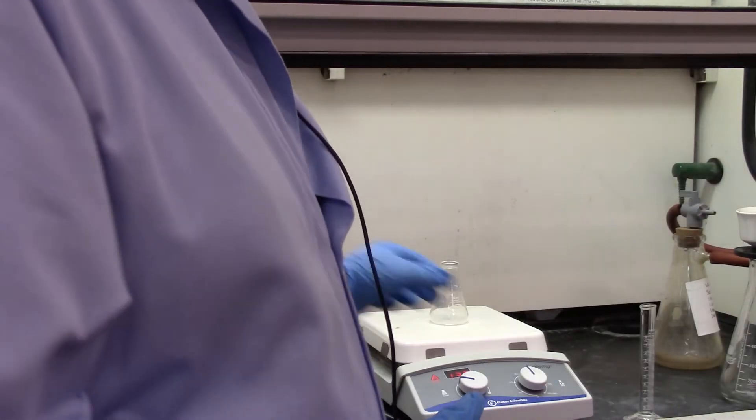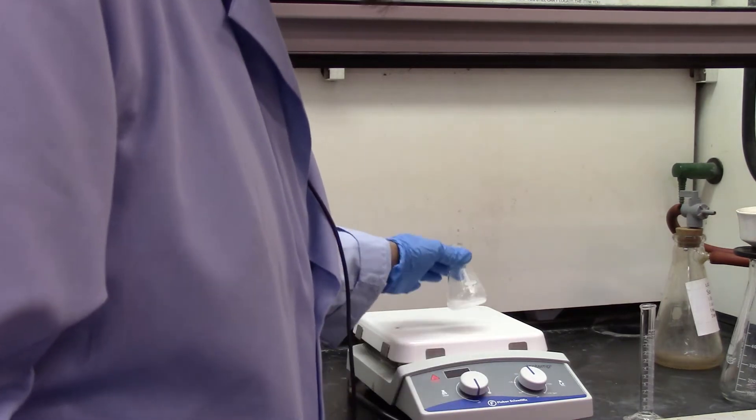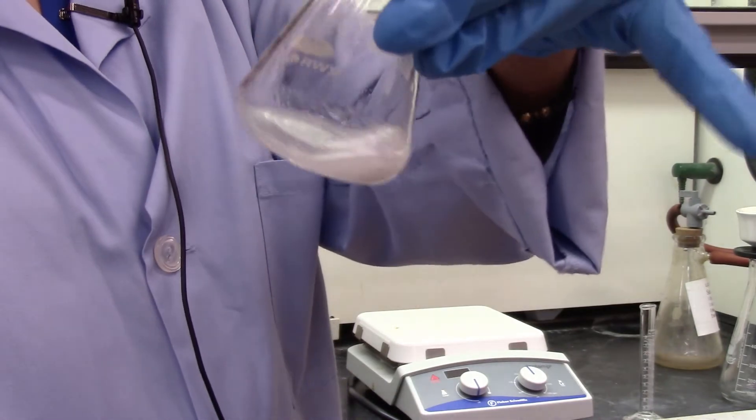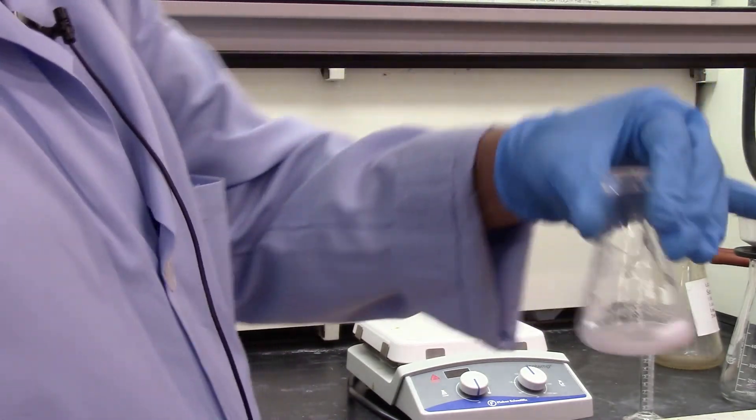So it's been about 10 minutes and I'm going to turn off the heat and take this off the heat. You can see it's not completely dry yet. There is some liquid or methanol left. So I will let it cool down.